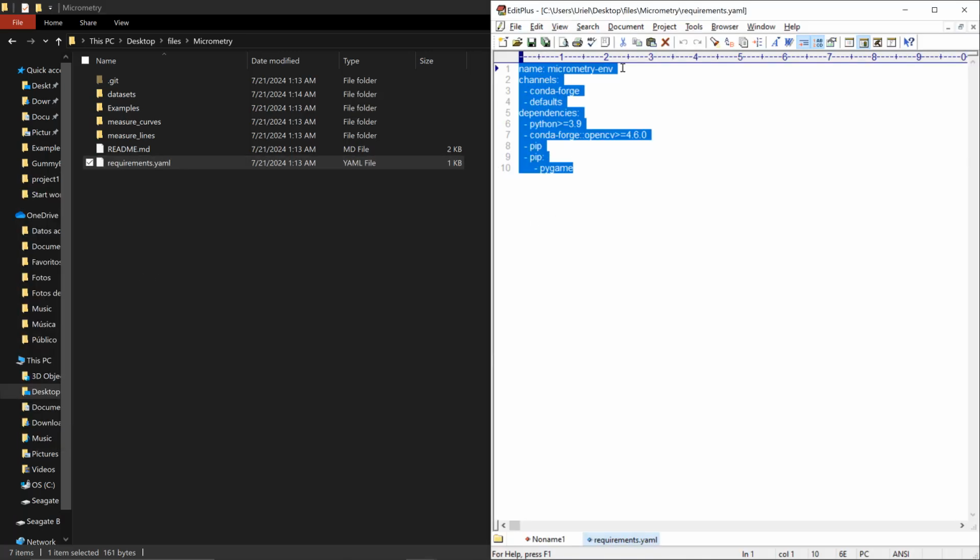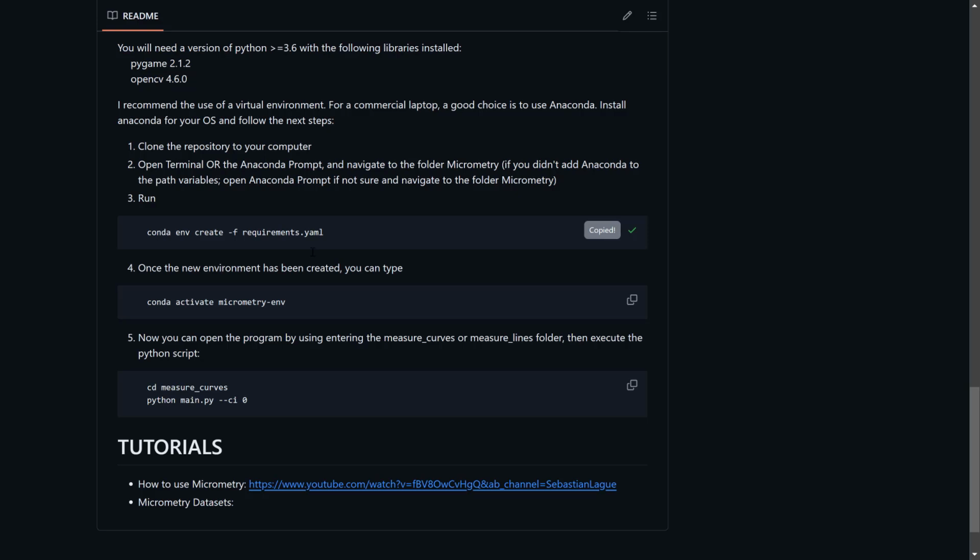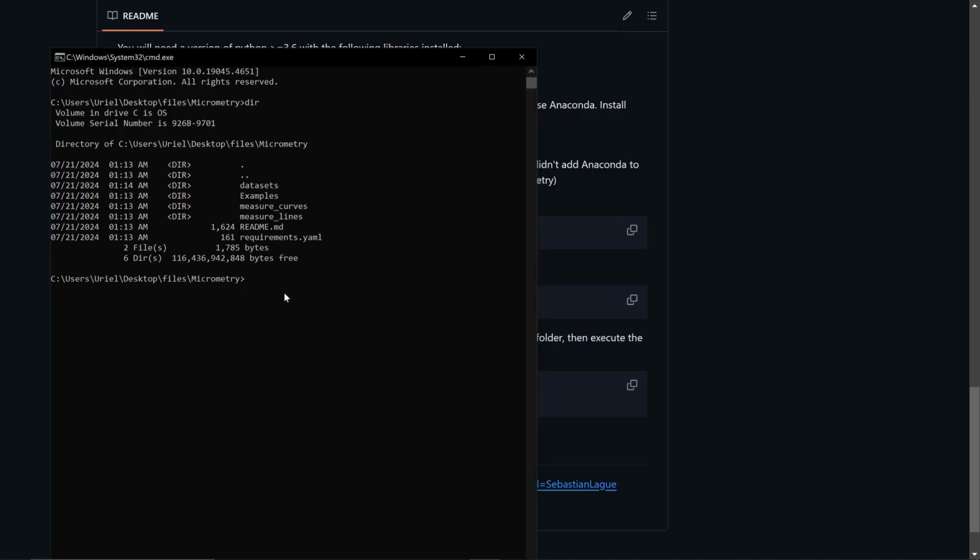You can see here that the program will create a new environment called micrometry-env. You can change it if you want, and it's going to download these dependencies or sublibraries, including the Python library, from these channels. That's where to find them on the internet. So let's run this. Here I need to make sure that I still have access to the clipboard element that I just copied, and I right click on it. Let me fix those extra spaces, and then I can press enter.